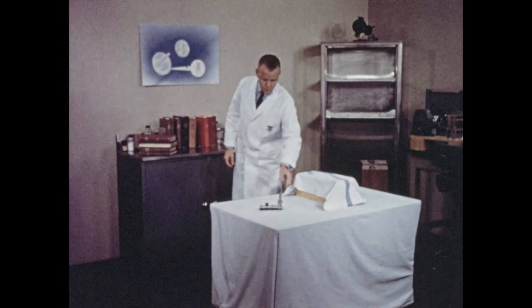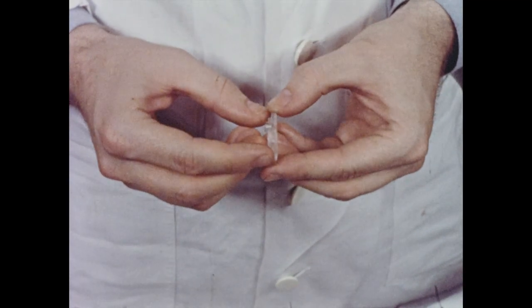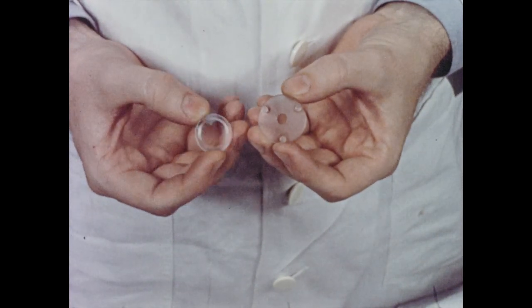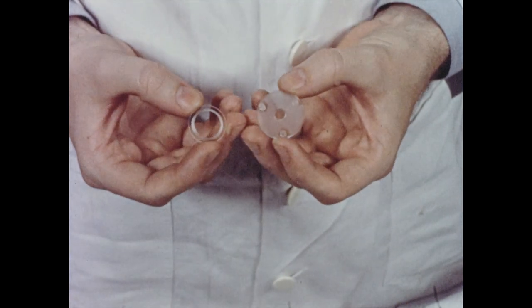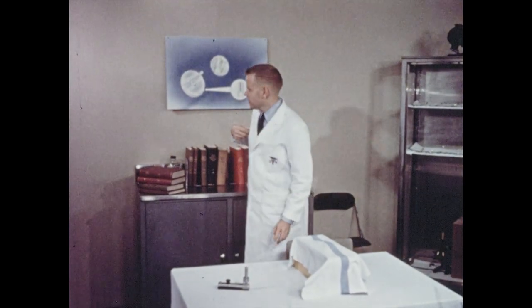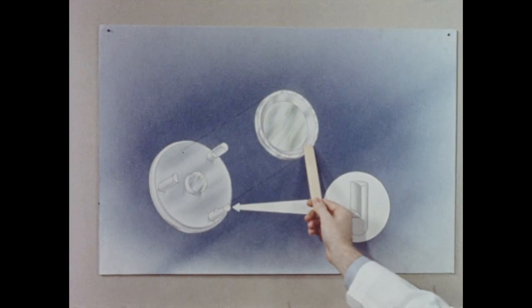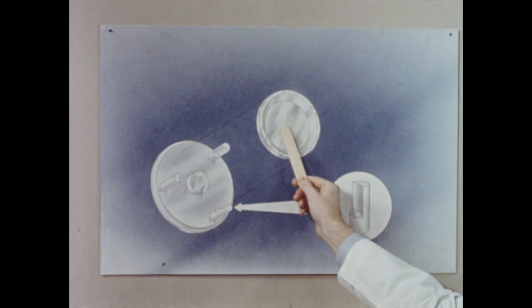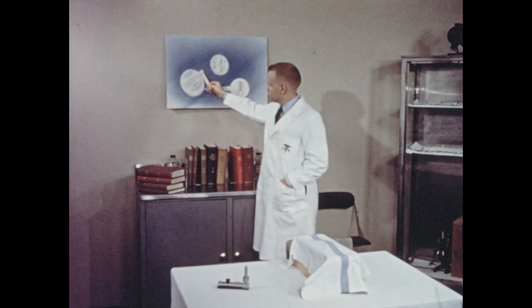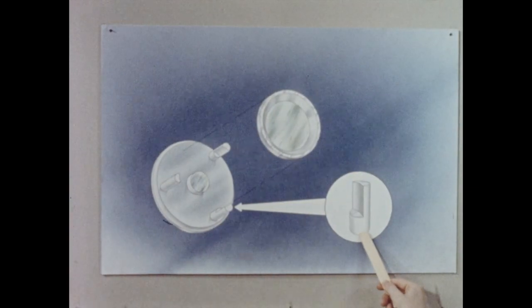We have here one of the chambers, similar to the one first described. It is composed of two parts: the circular plastic rim, to which is attached the circular glass cover slip, and the plastic base plate. We have here a diagram which shows the features of this chamber — the circular plastic rim, the circular glass cover slip, and the base plate with the three supports, each of which is shown here at greater magnification.